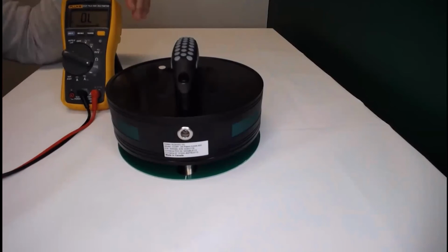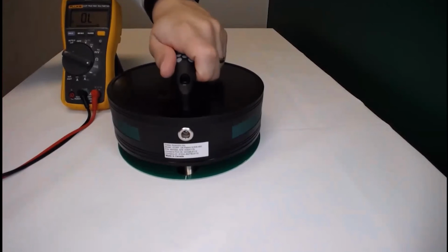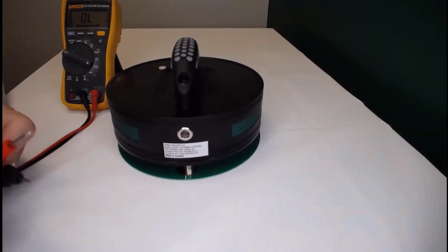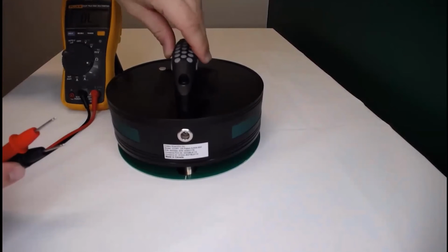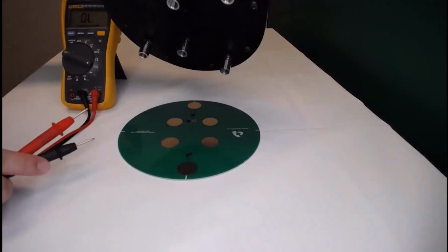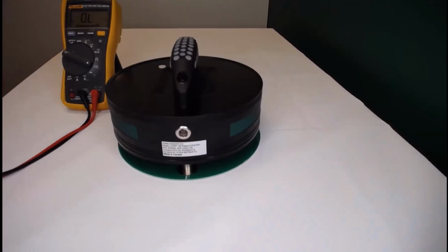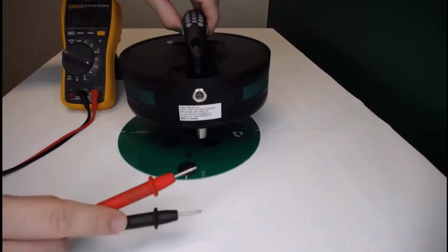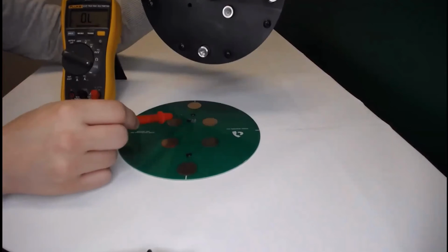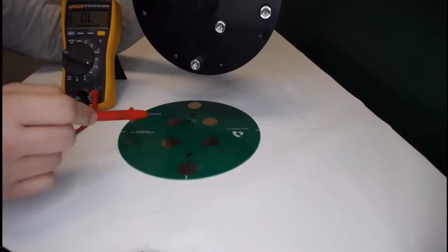If you don't hear the beep on the first place, you can ask someone to help you to press down the device and then test the continuity between shafts and metal faceplates. If still you don't hear the beep, make sure that you clean the electrodes and also the verification disk to make sure that it is free of dust or any debris over there. Also, we need to make sure that we test the inner electrodes onto the inner faceplates as well to make sure that those have electrical continuity.